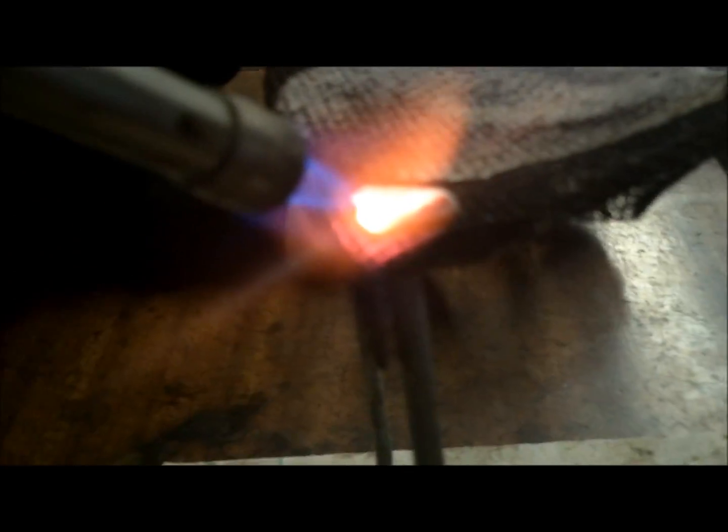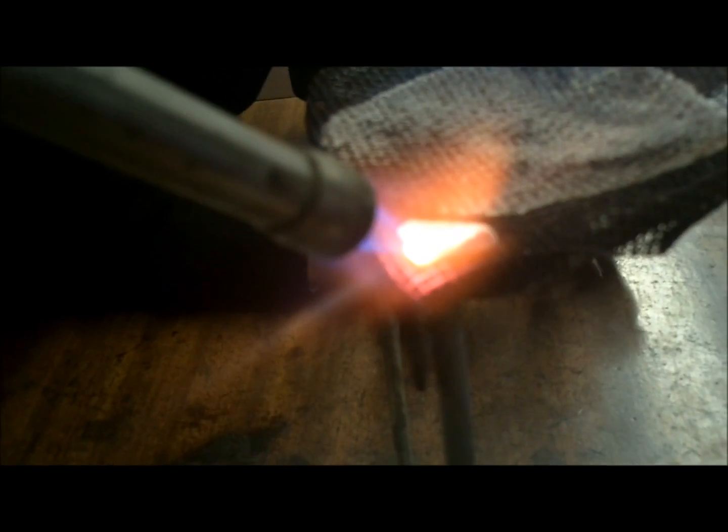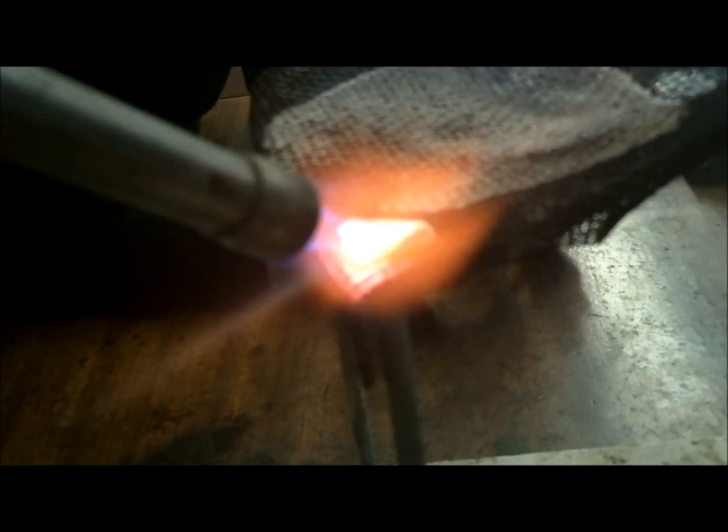How long are you supposed to do this one? That should be long enough, I'd say. That is good stuff. I think white heat. I think there's a bit of that firework stuff — sulfur, phosphorus? Whatever it is, green stuff. I think we should stop burning it.